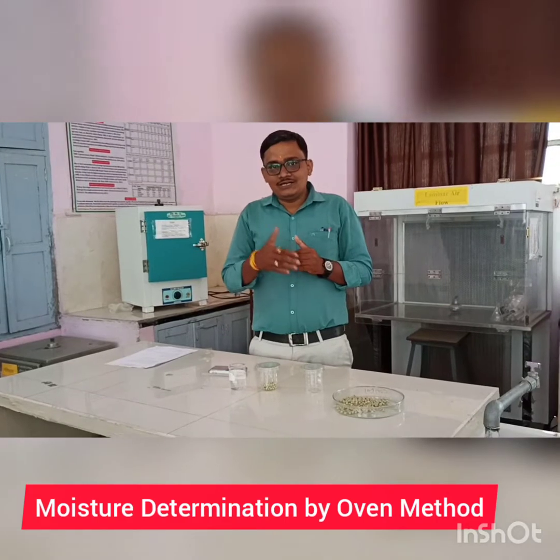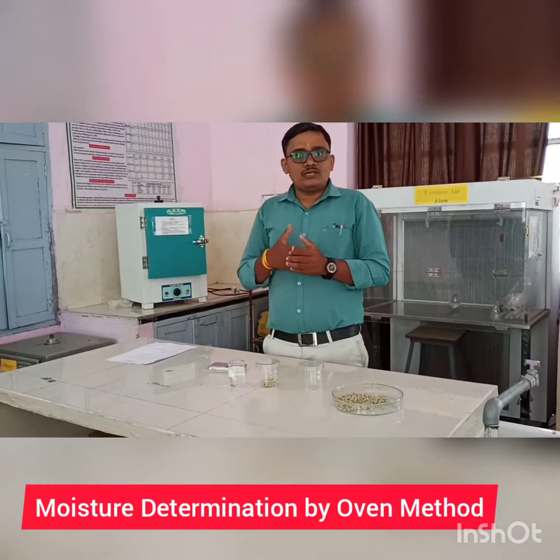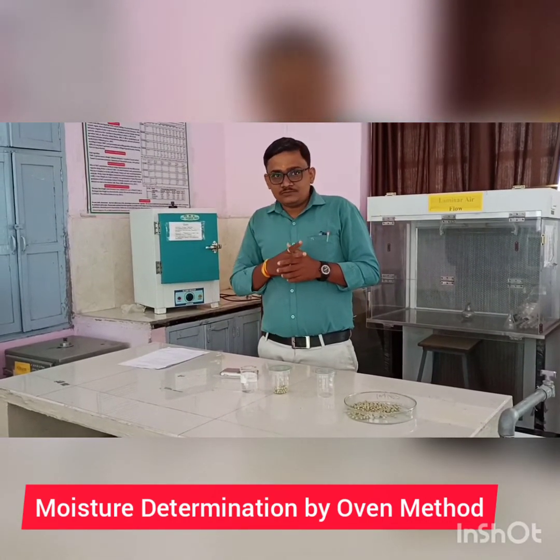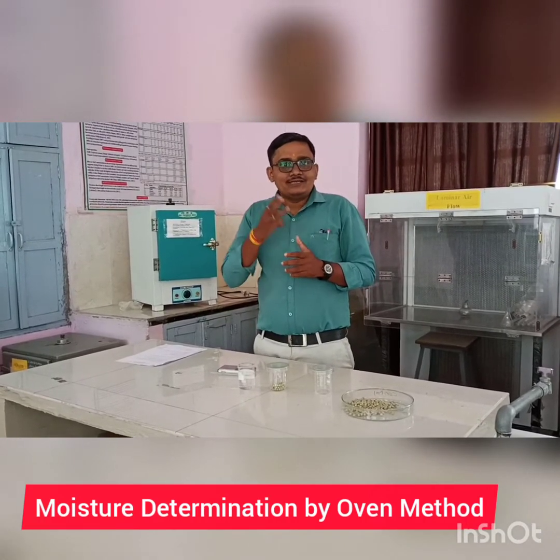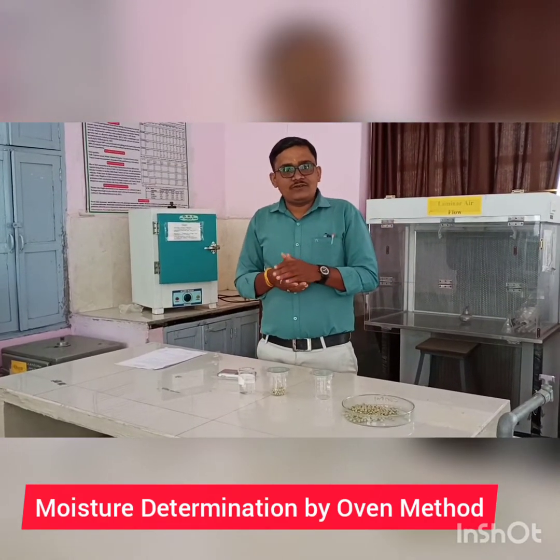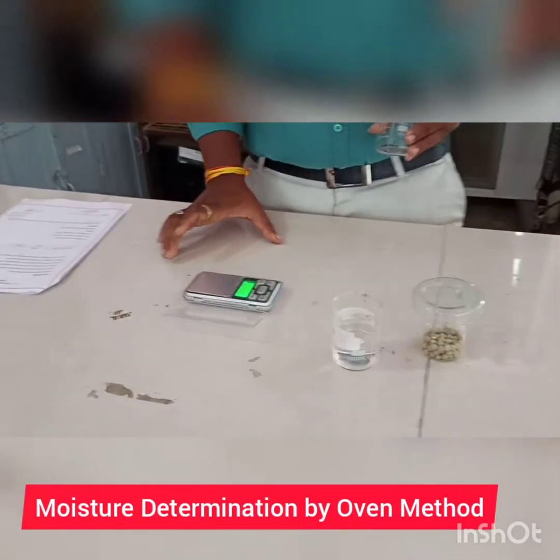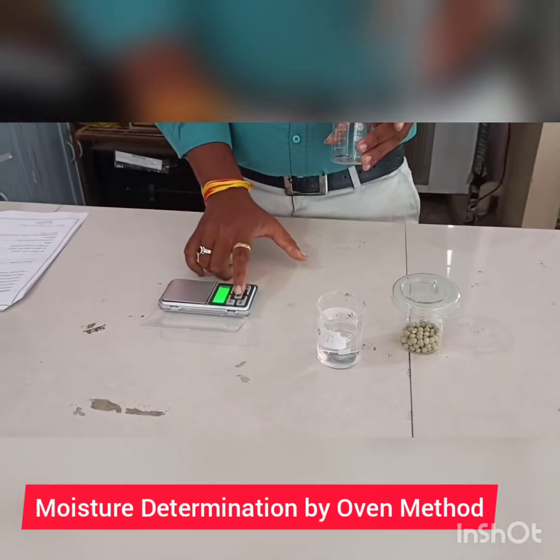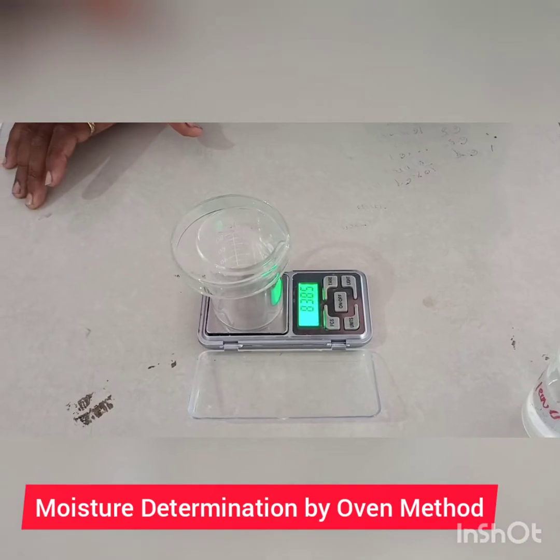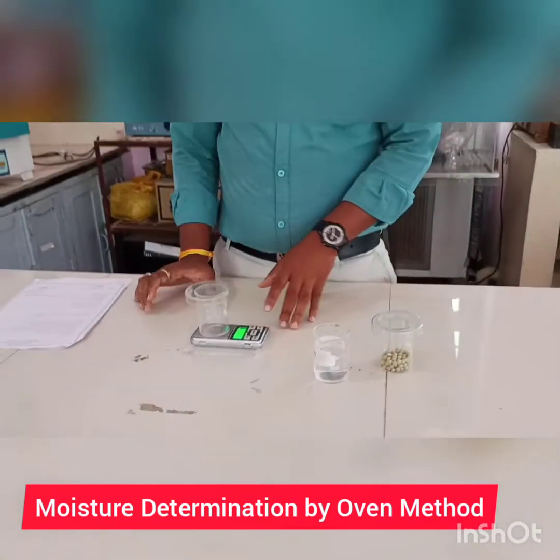By giving heating treatment with the help of the hot air oven method. In this method we have to take the weight of three samples: the weight of the empty container W1, the weight of the seed sample with the container W2, and third the weight after drying of the seed W3. For taking the weight we use a micro balance. First we make it zero, then take the weight of W1, which is 83.84 grams.